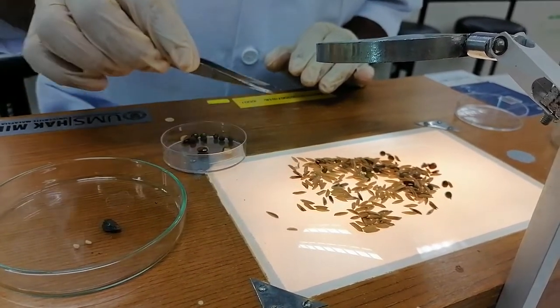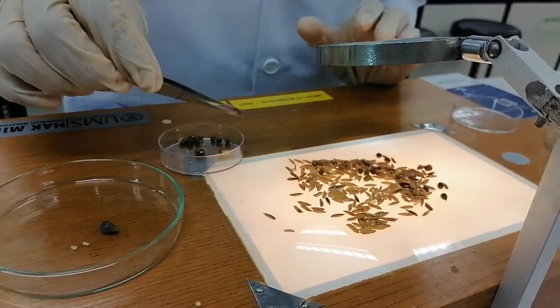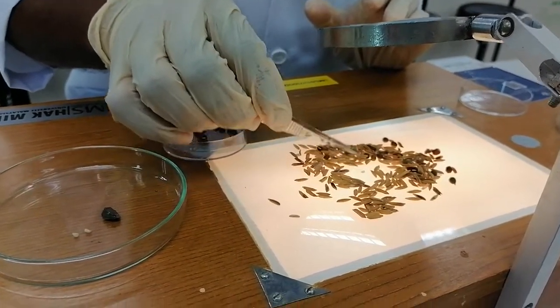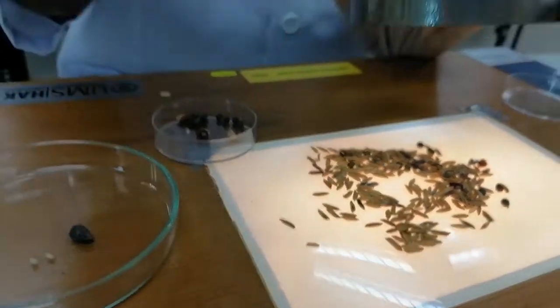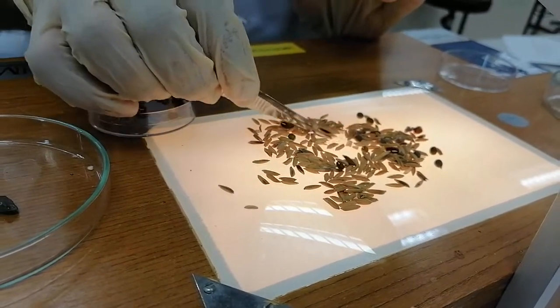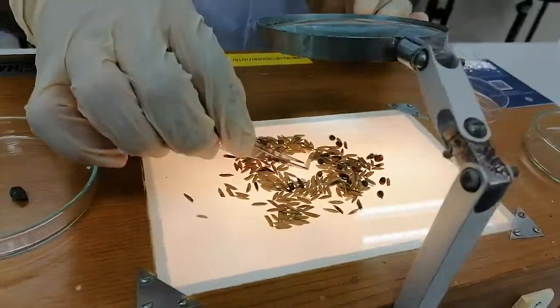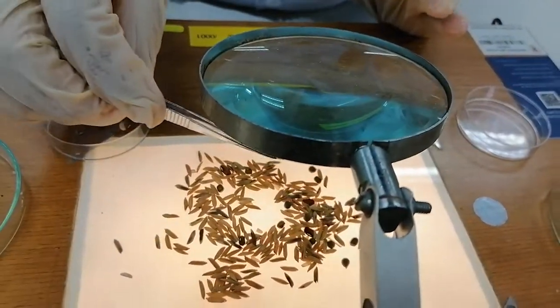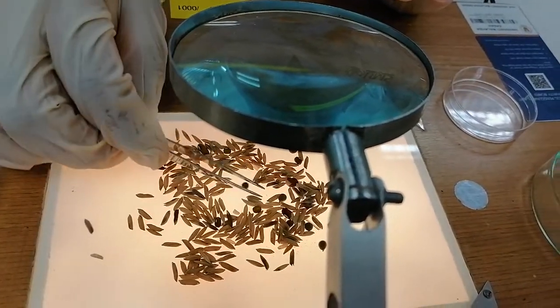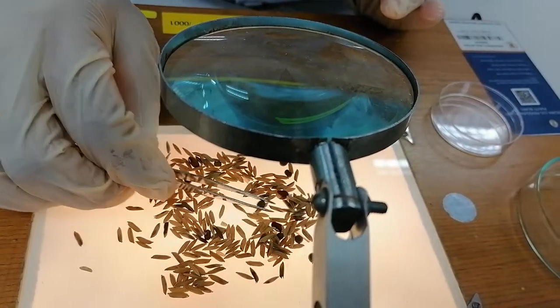There are several sections. We are using the power glass because the size appears much bigger, making it easy to separate one by one. This piece is less than half, so we have to consider it as inert matter. This one is more than half, so we consider it as pure. But this one is inert matter — maybe other plant parts. All these are other crop seeds, so we have to separate them one by one.